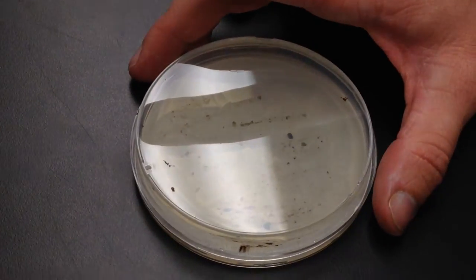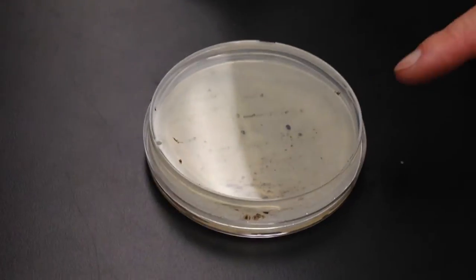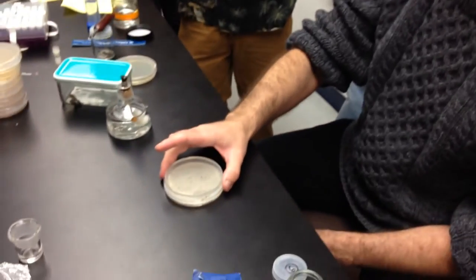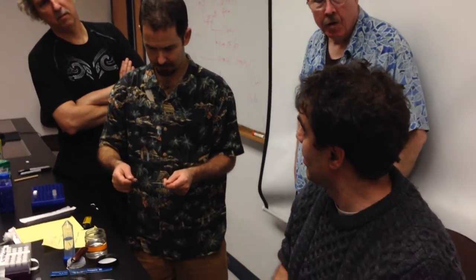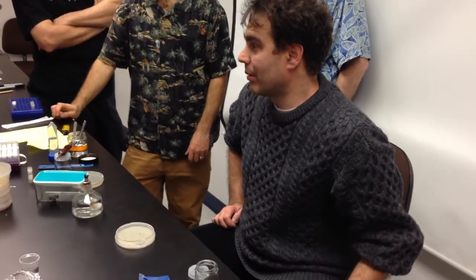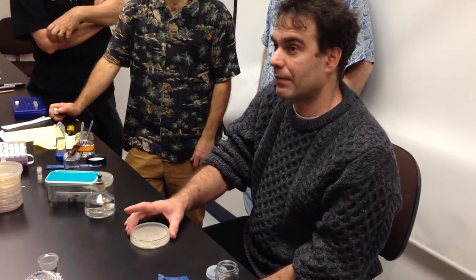This is supposed to be pretty fast, because the conidiophore from Basidiobolus develops within hours. This is forming the conidiophore — it's going to have the capitate conidium and it's going to shoot. This is about one centimeter distance between the paper and the lid. When I see the colony, I'll just cut it and transfer it. Is it phototropic? I don't think so — not really. I think it's gravitropic. It might be more intense shooting of the spores during the day, I don't know, but there are no carotenoids or anything like that. And this is the method for Basidiobolus — yeah, it worked like a champ.